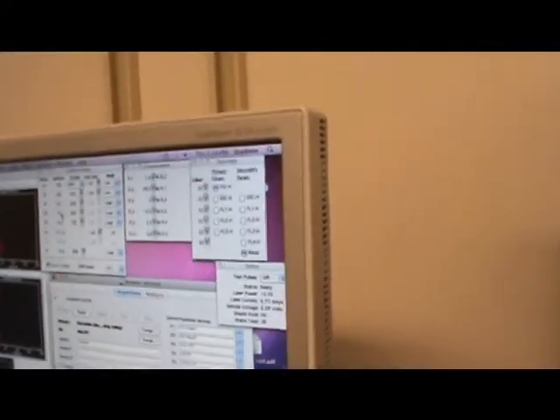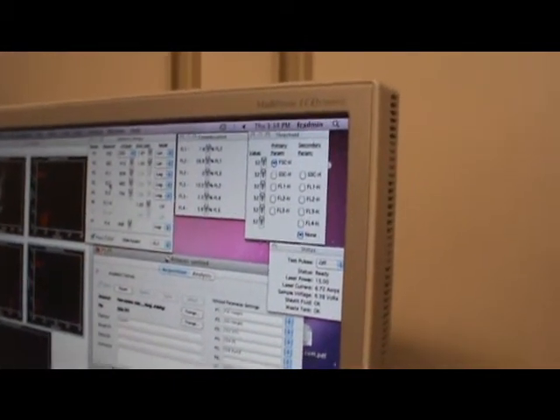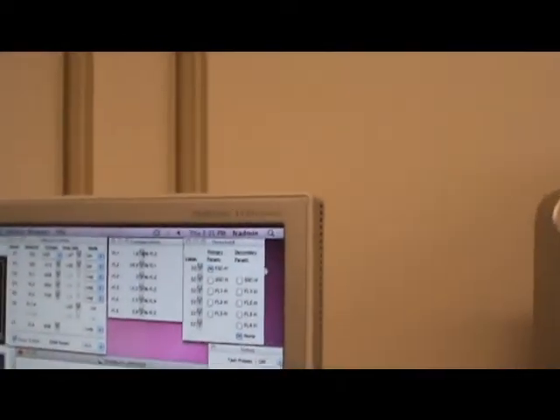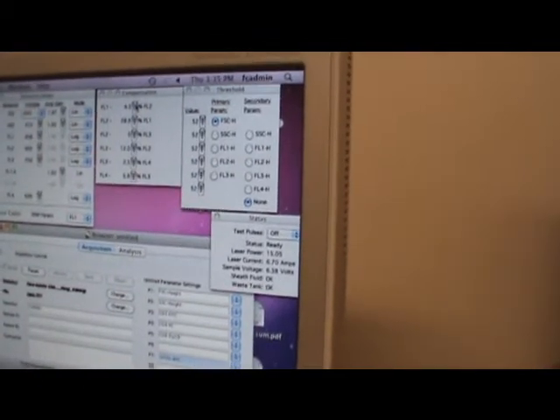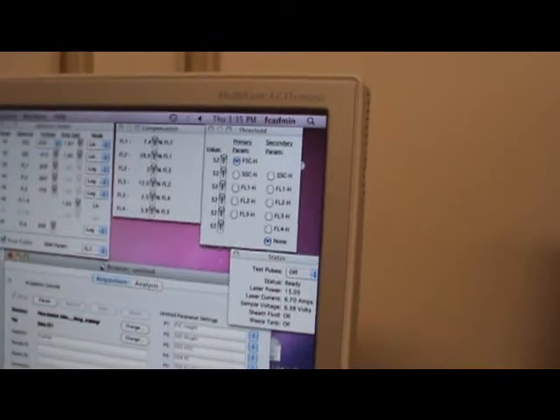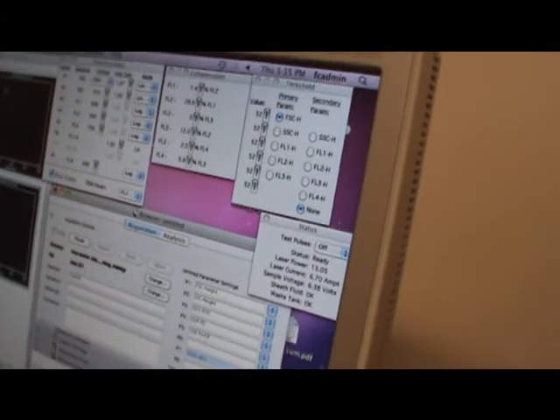Okay? So if previously I was looking between, I put FITC, so the problem is most likely between this and this. You can see from the screen. Okay, and now I have put PE. There is no overlap, but if I change this, look at this value. See, it's all overcompensated. It just went inside.